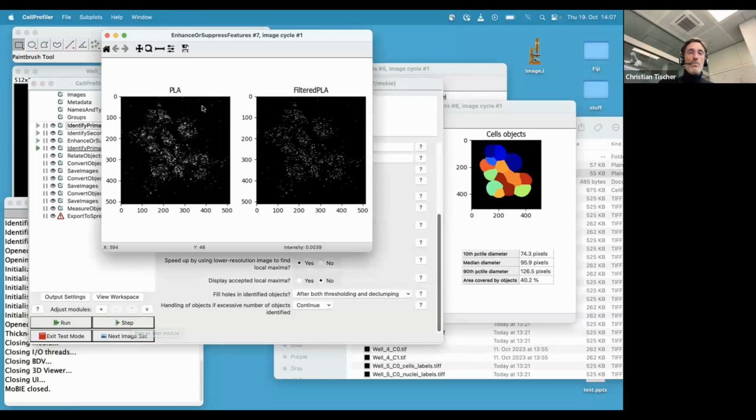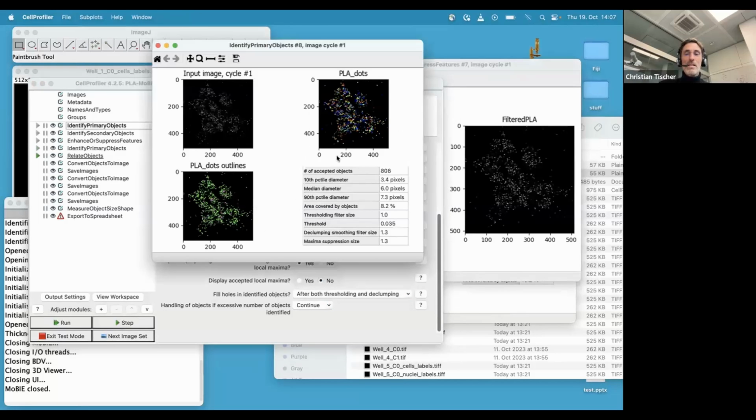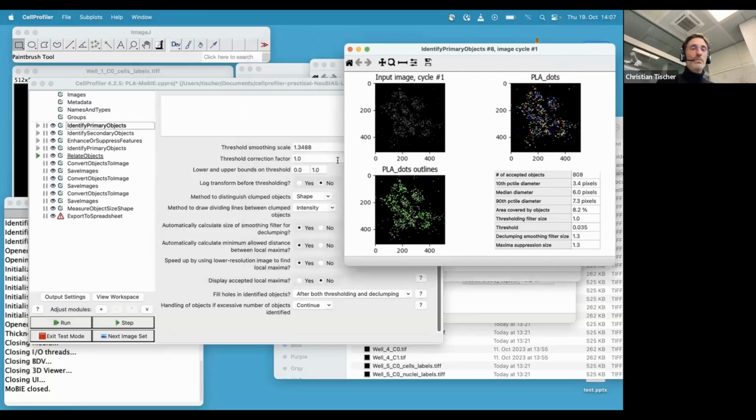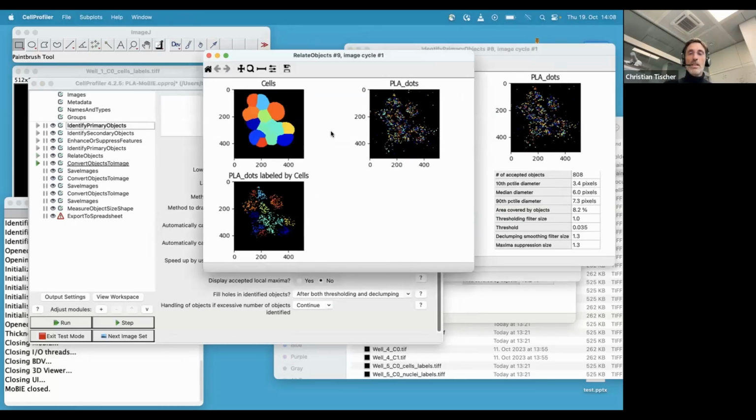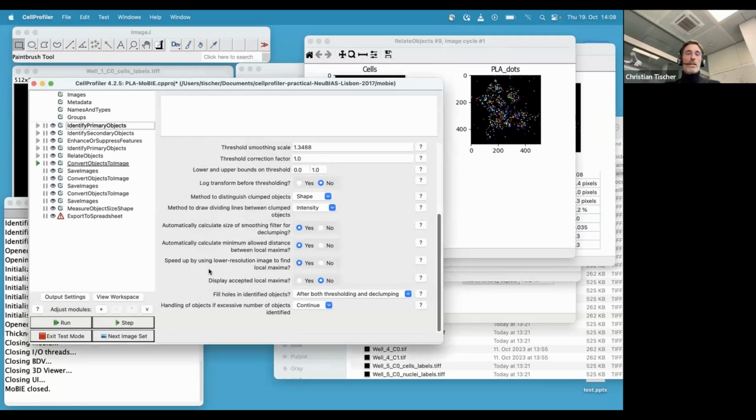Then we actually want to find some spots. They're called PLA. I forgot the biology, but some important proteins in these cells. So we enhance them a little bit, and then we segment them again by some thresholding. So all standard stuff in terms of CellProfiler. Then what you can also do in CellProfiler is you can then assign each dot to a cell. And in this project, for example, counting how many dots are per cell was one of the main biologically relevant measurements.